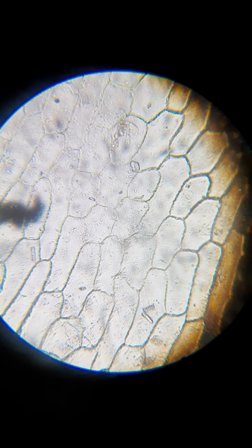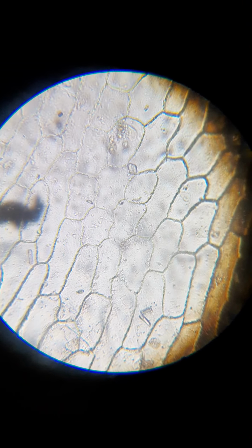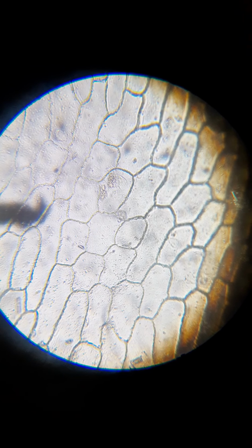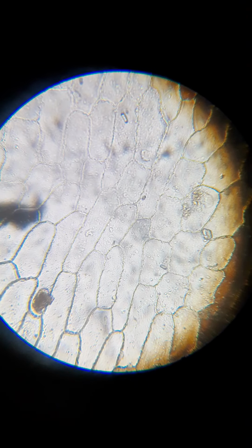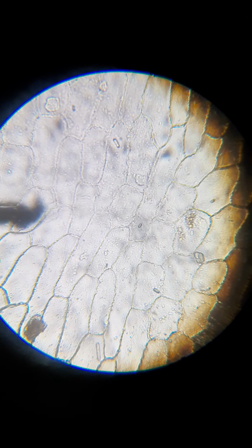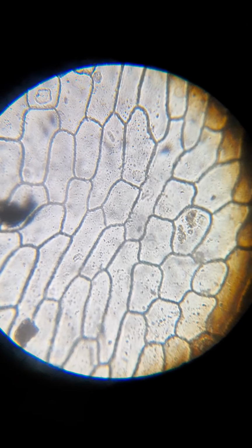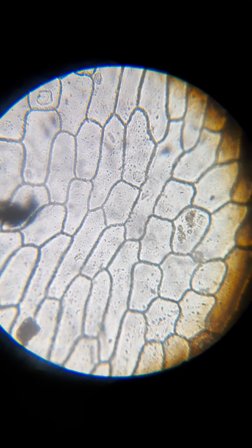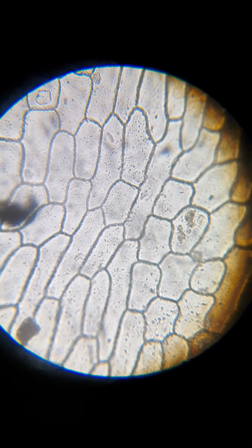That's because the dark areas that you typically see, those dark borders, that's actually the cell wall and the cell membrane together. And you see these ones here are super thin because the membrane is being pulled away from the cell wall. Nope. That's not, well, it is a little bit thinner, but not too much.